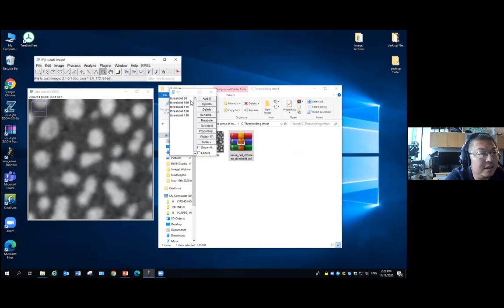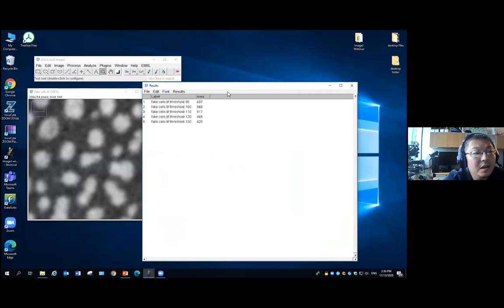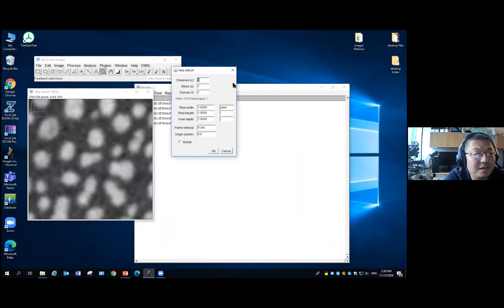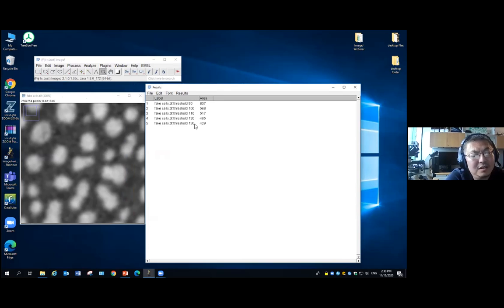Sometimes you want to make it clear. When we set up the measurement, you can also show the label. Display label. So now when we measure this, you will see which one corresponds to which label. When we set the threshold as 90, the cell size is the biggest. The cell size is 637. And what is the unit? We can check. This is pixels. Once you see it's just a whole integer number, you'll know that we lost the pixel scale in this picture. So that's just how many pixels. And when the threshold goes to the highest, the size is 429.